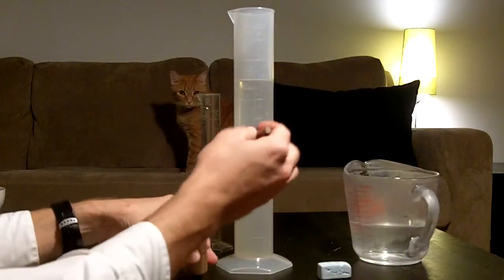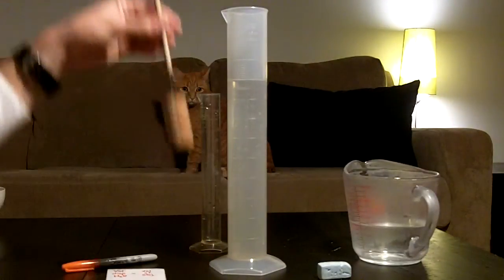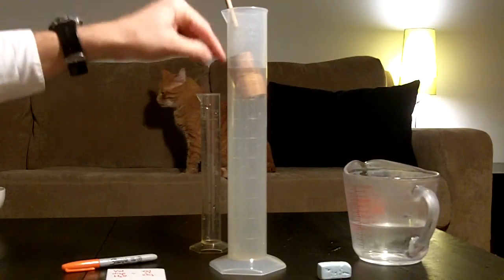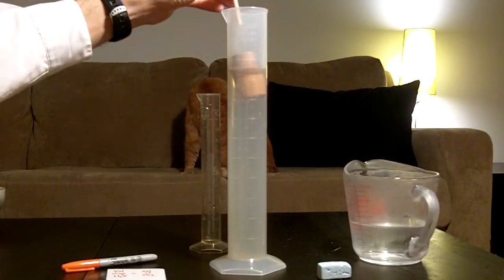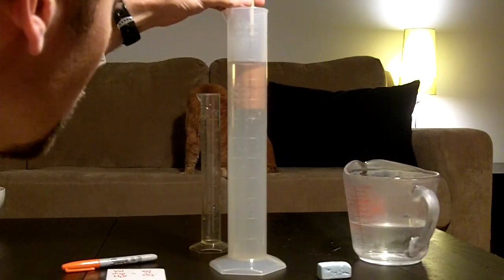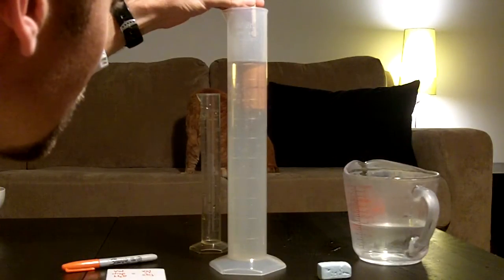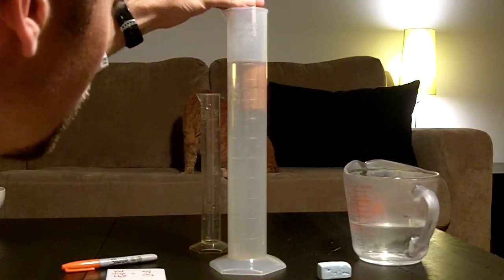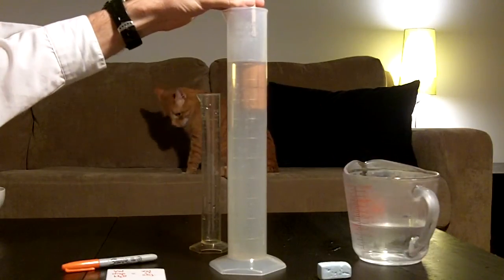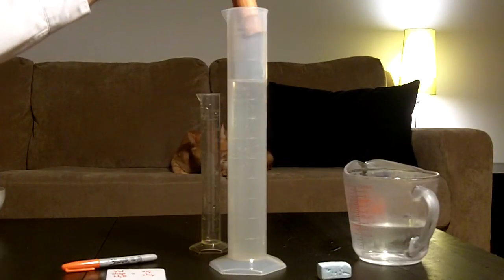So then I'm going to place my object in here, and we notice that it's a floating object. So if I just read it now, it'll only be the part that's underneath the water. We have to get all of that object underneath. And when I do that, I look very carefully, it's slightly above the 490 line. So I have to read in between the lines. I'm going to say it's 491, pretty much. 491 milliliters.